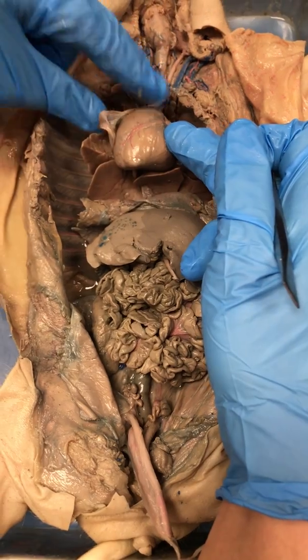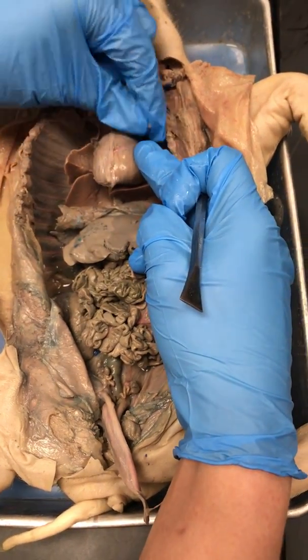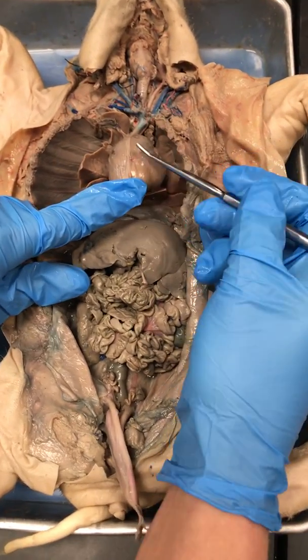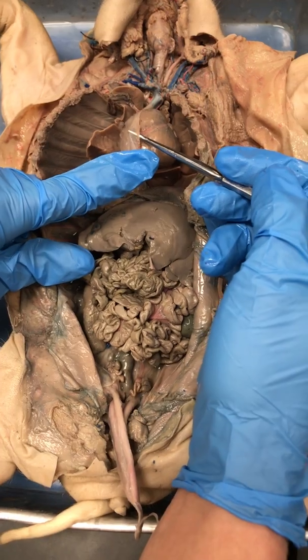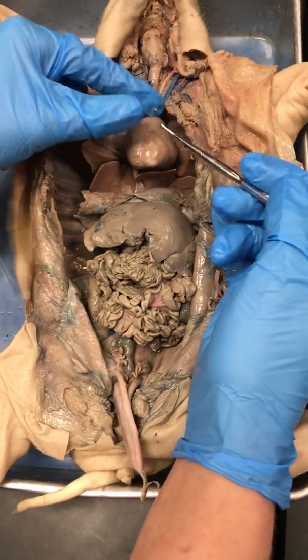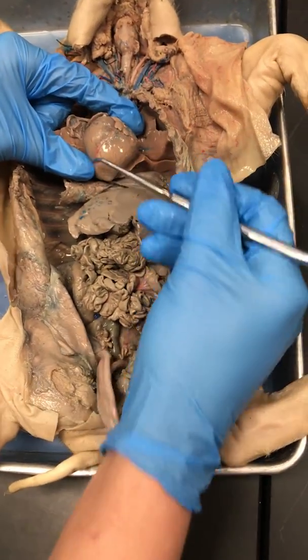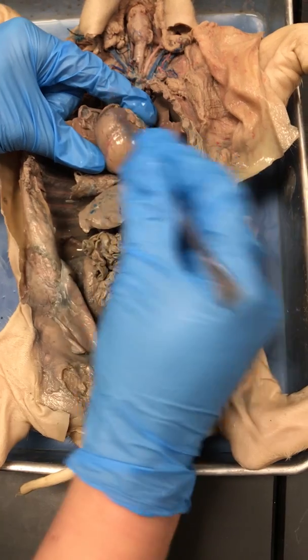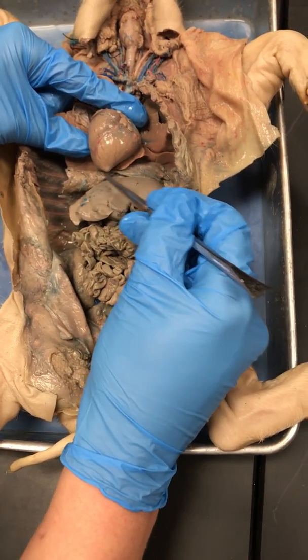If we had not already dissected this heart, you would pay attention to this thin little membrane surrounding the heart. That thin membrane is called the pericardium. You guys do need to know that. When we flip the pericardium back, we see the actual organ of the heart. As I tilt it down, you've got the apex of the heart down here, the base of the heart up here. If you notice the apex of the heart, you see the pointy end.